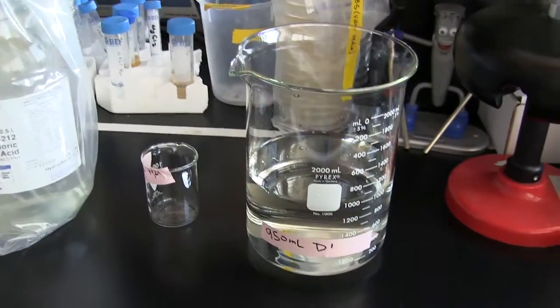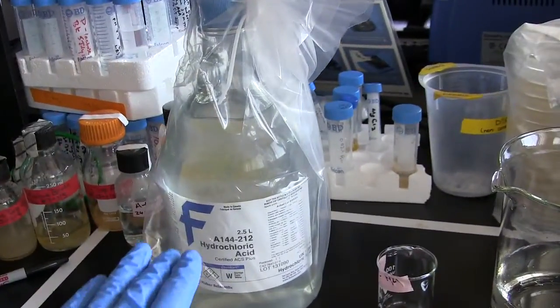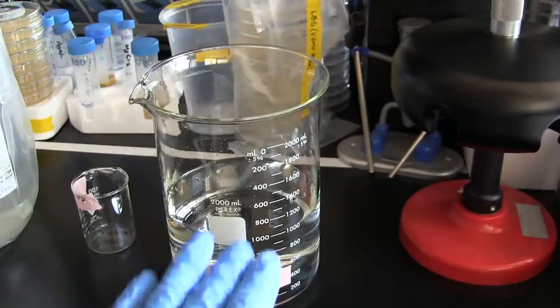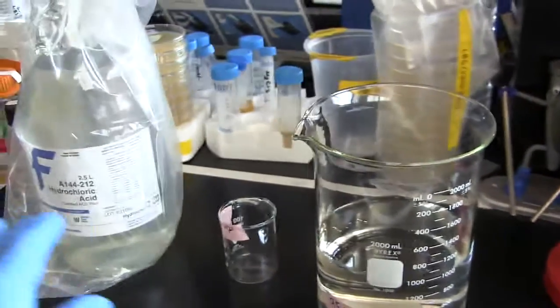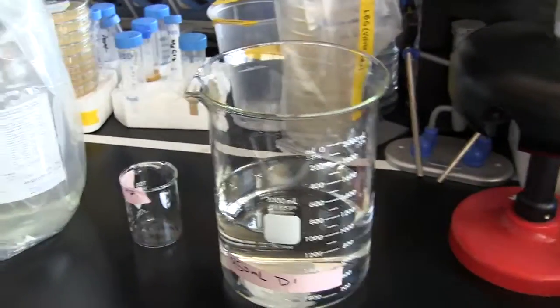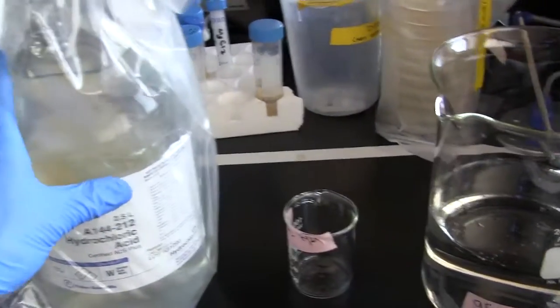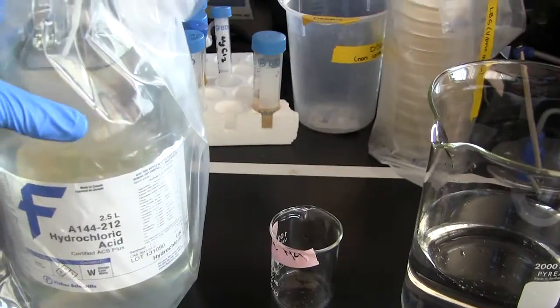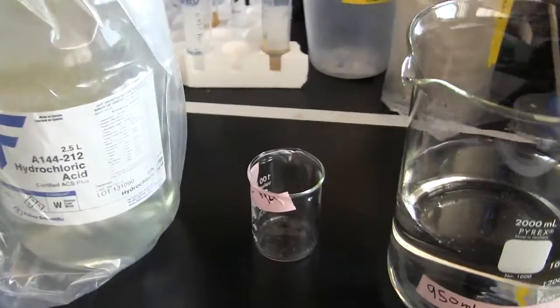You make a dilution of 1 part concentrated hydrochloric acid into 19 parts distilled water. That's a 1 in 20. You don't do it based on the percentage that comes out of the bottle. You're doing a 1 in 20 dilution of concentrated hydrochloric acid.